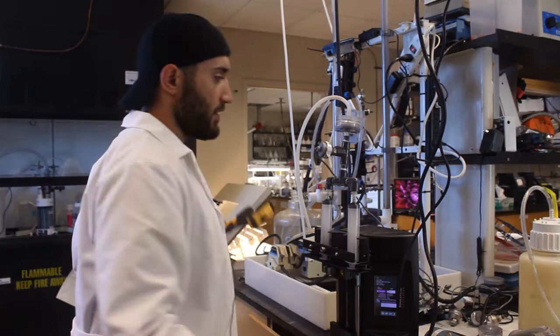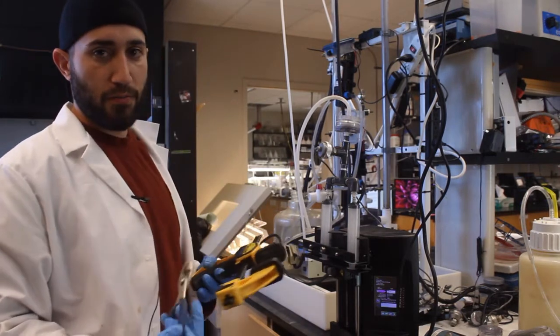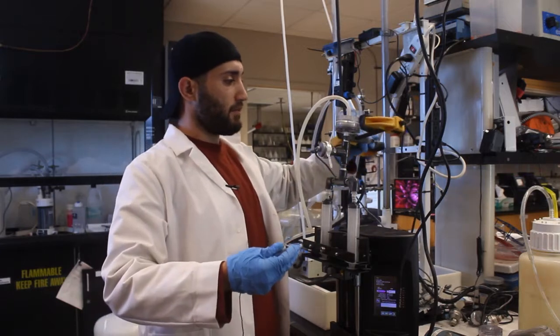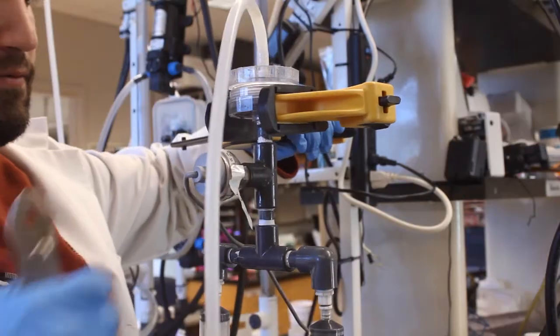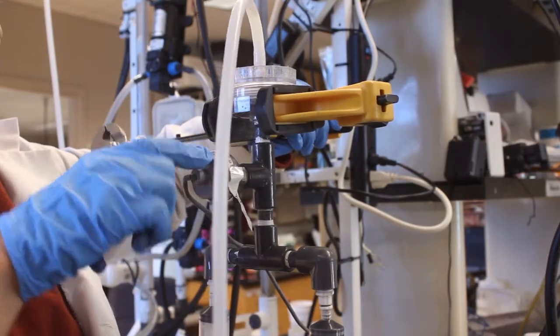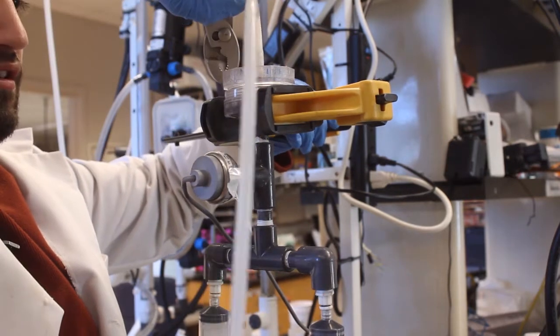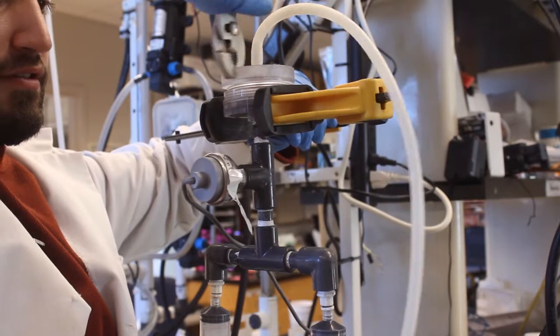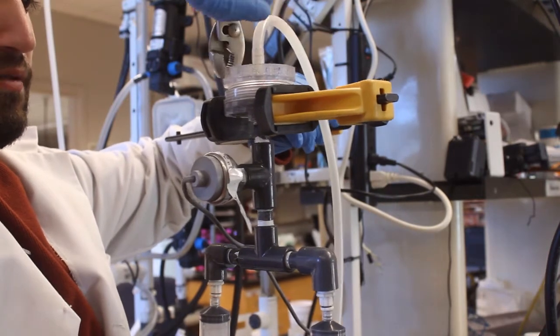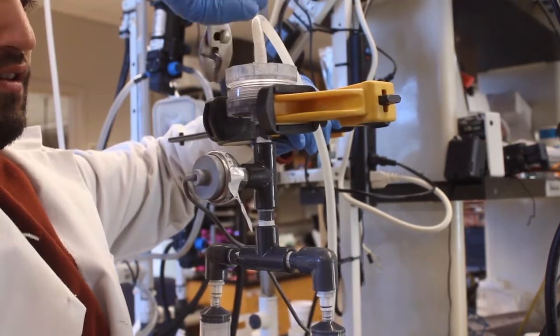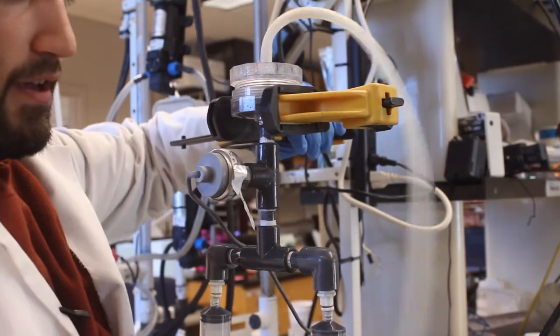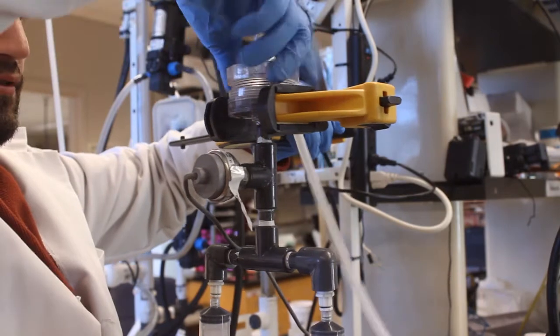Normally before this test is done we would already have the membrane open. But I just wanted to show you the procedures to take off the membrane housing. The first thing we are going to do is clamp onto the bottom ring, take our wrench onto the top ring, and gently break apart. Sometimes it is stuck and does require more force to remove. After we have broken it free we are just going to loosen it by hand.